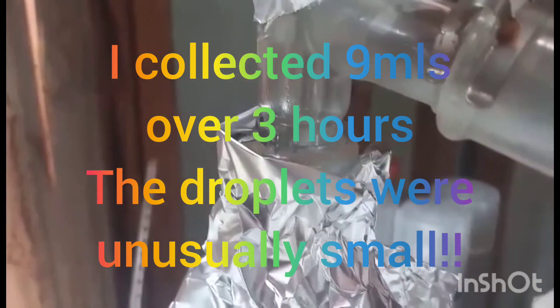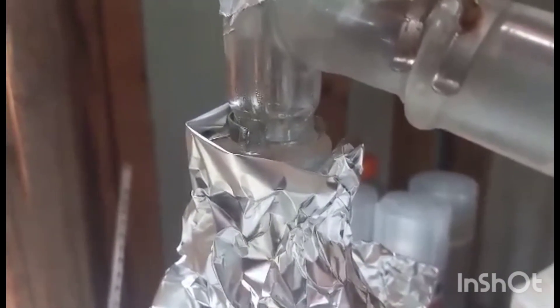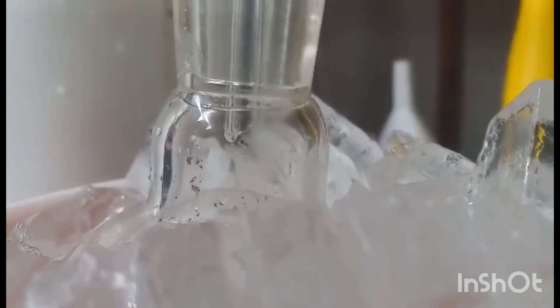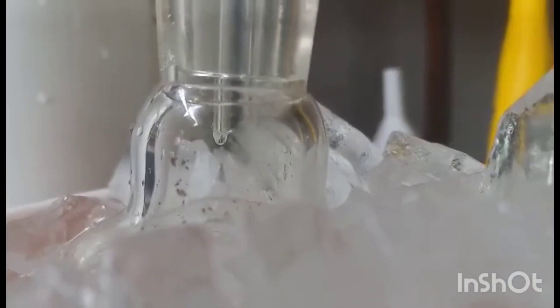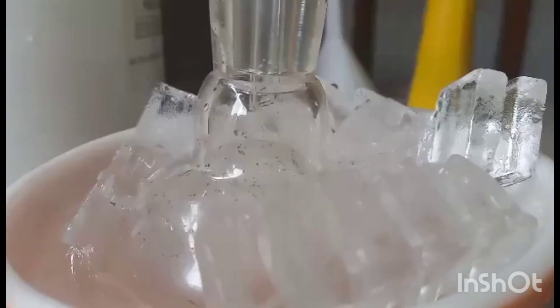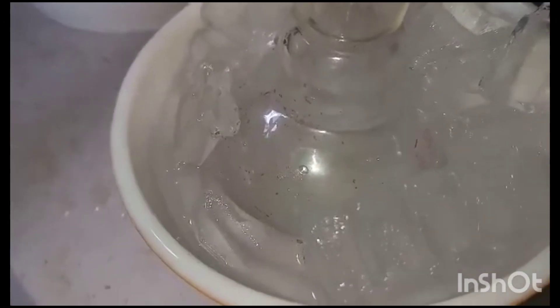We're actually seeing a little bit of the about-to-be distillate coming — expected condensation of methyl iodide in the condenser. There we go. Little tiny oily droplets; it's quite hard to see, but there's distillate down there.